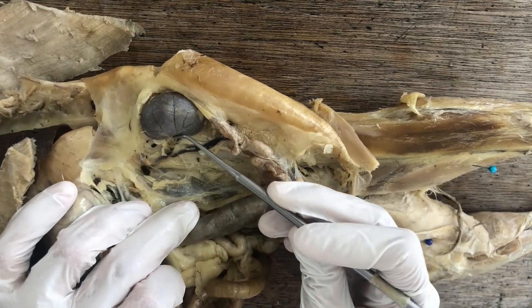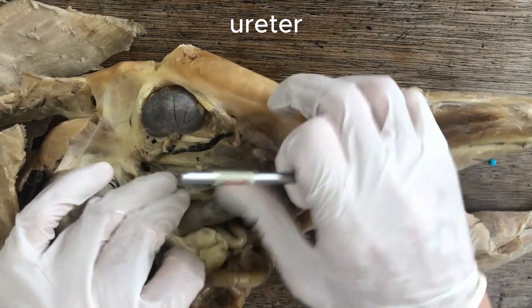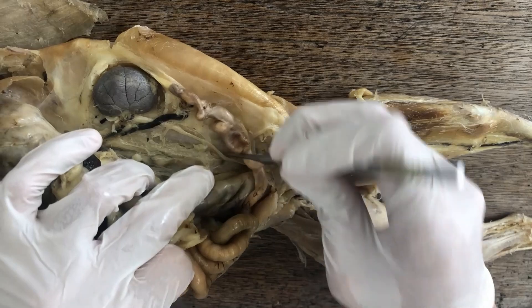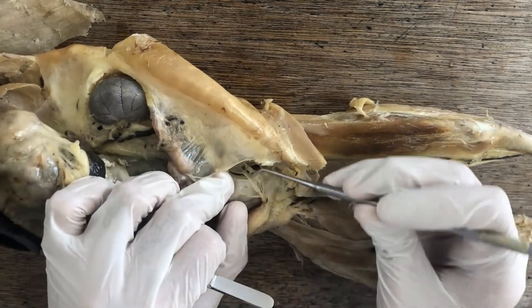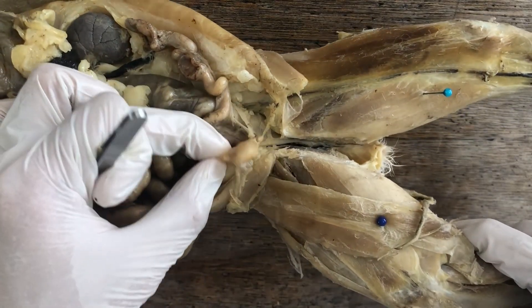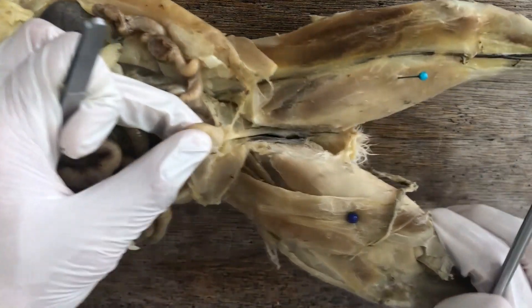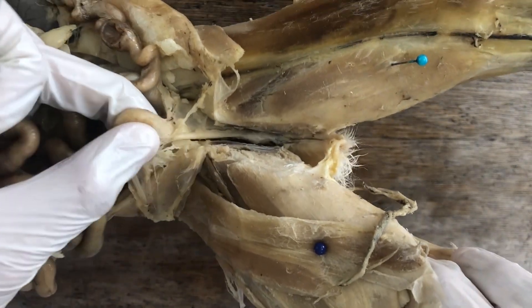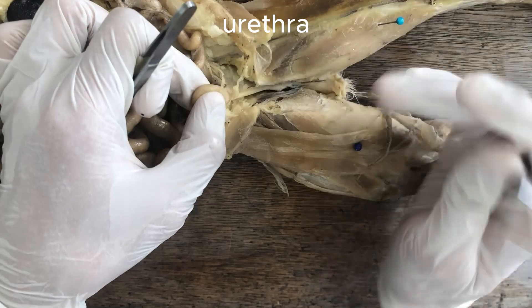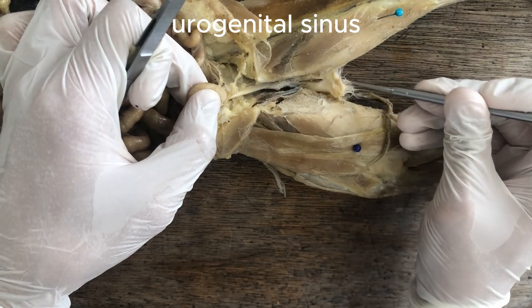The kidney produces urine containing all the wastes and excess water and solutes, and flushes that urine into the kidney duct called the ureter. Here's the ureter — this white tube here — and if you follow it posteriorly it will drain urine into the urinary bladder. From the urinary bladder, urine flows into the urethra and then down into the common urogenital sinus and out through the urogenital opening.